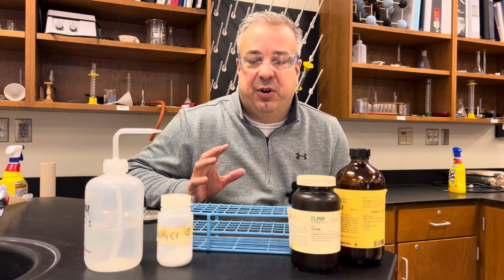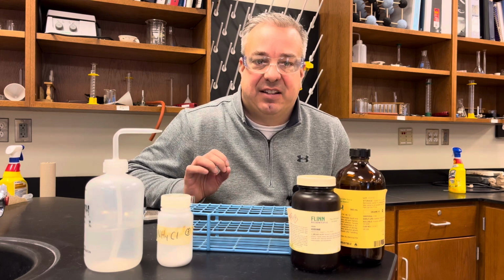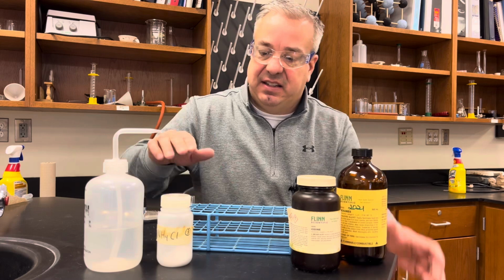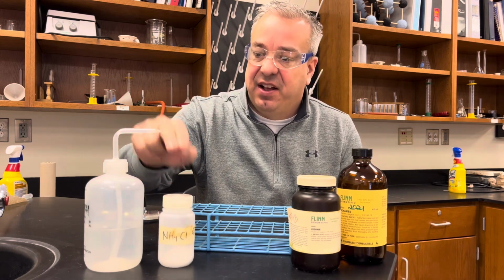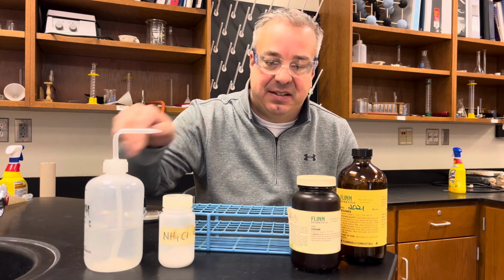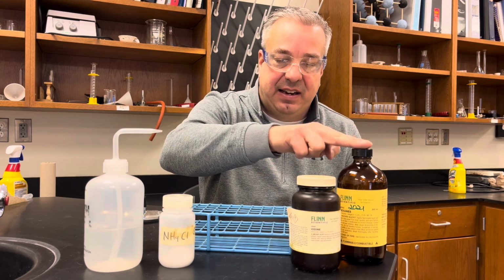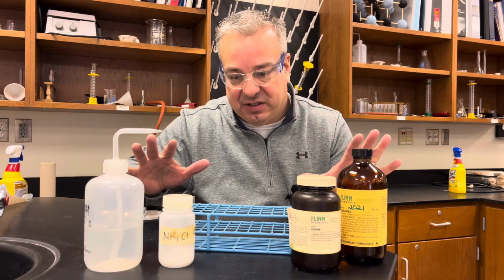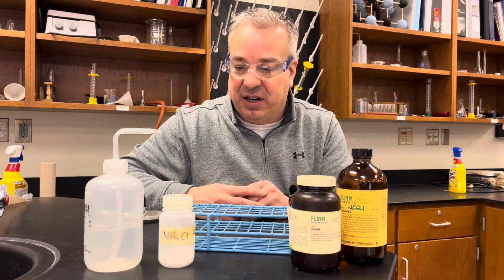In this video, we're going to do a demonstration of the saying in chemistry that's called "like dissolves like." And what that means is that if we have an ionic or polar solute, it will dissolve in a polar solvent. Likewise, if we have a nonpolar solute, it'll dissolve in a nonpolar solvent. But when you crisscross them, they won't dissolve. And we're here to prove that point with a demonstration.